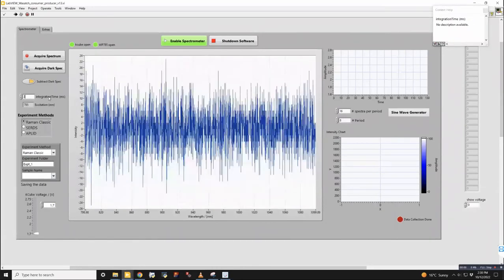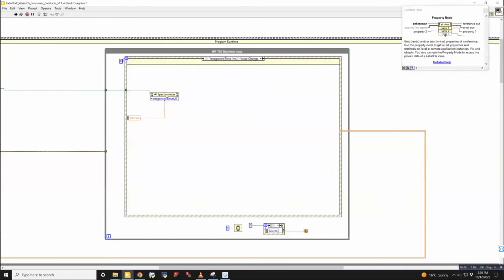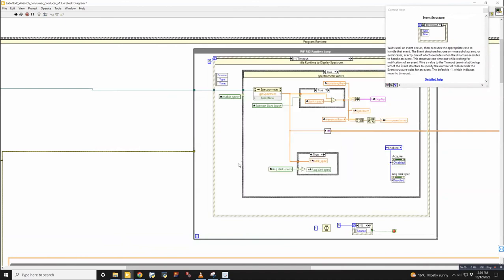So if I change this to 200, what will happen is this will execute one time, and then the new value of integration time right here is fed into this property node. So the property node has a link from the initialization here that tells you what the connection code is. I actually don't exactly know what this is, a .NET connection reference. So we send that into a property node, and then the property that we're trying to change is this integration time. And that's it. So this executes one time, and then it's back to the timeout case.